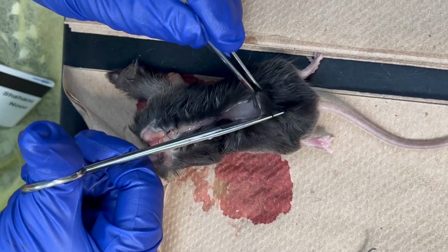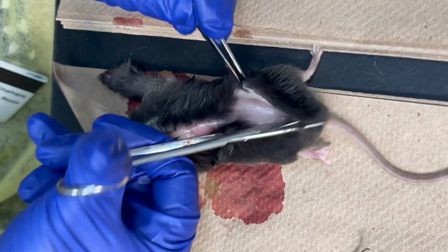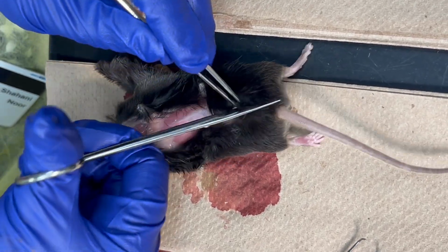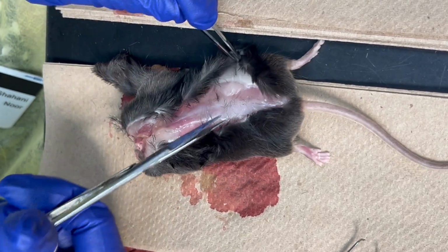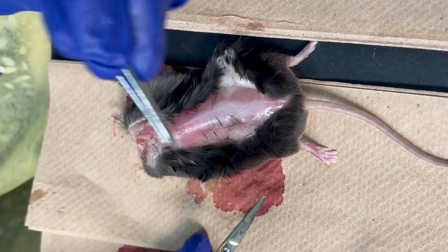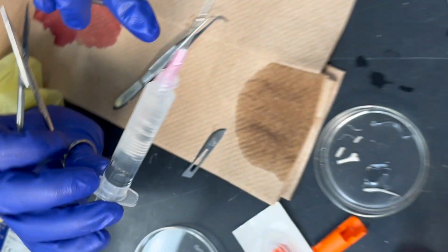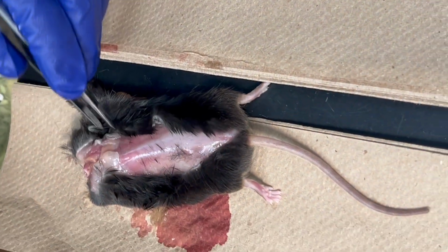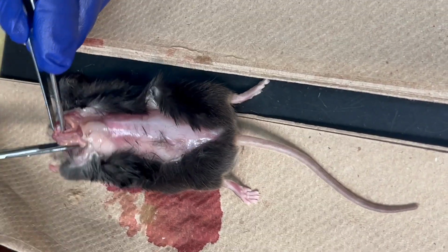But like I said, even I'm out of practice and that's why this one broke. You have to be in practice to feel where the pressure is. So there are two big reasons why sometimes it broke. One is cutting too far down, because the hole is really small and you end up breaking with the needle. The needle could also be a little bent over time. That could be one reason. And the other is not enough pressure. Those are usually the main reasons. Like you would use a new needle.